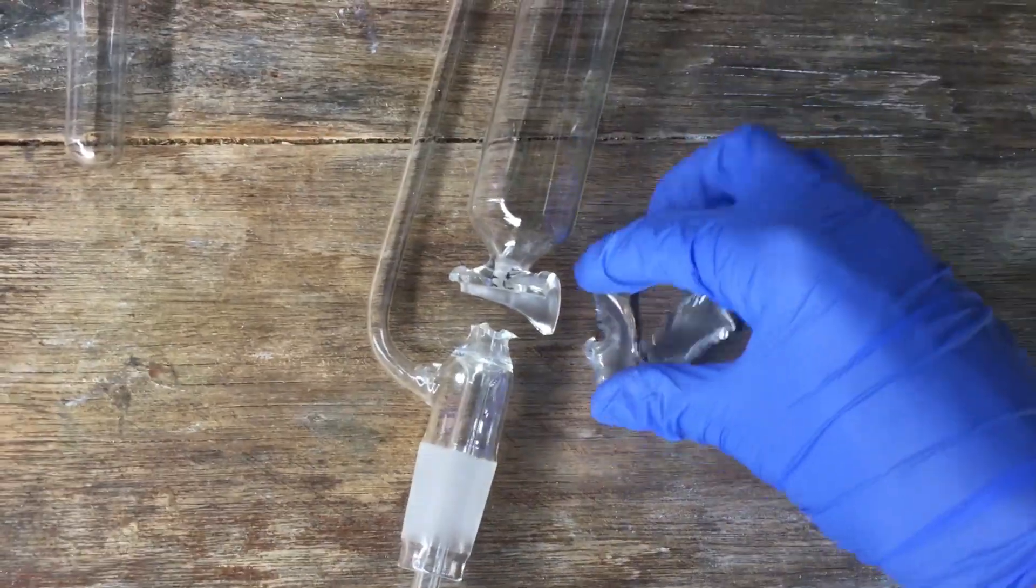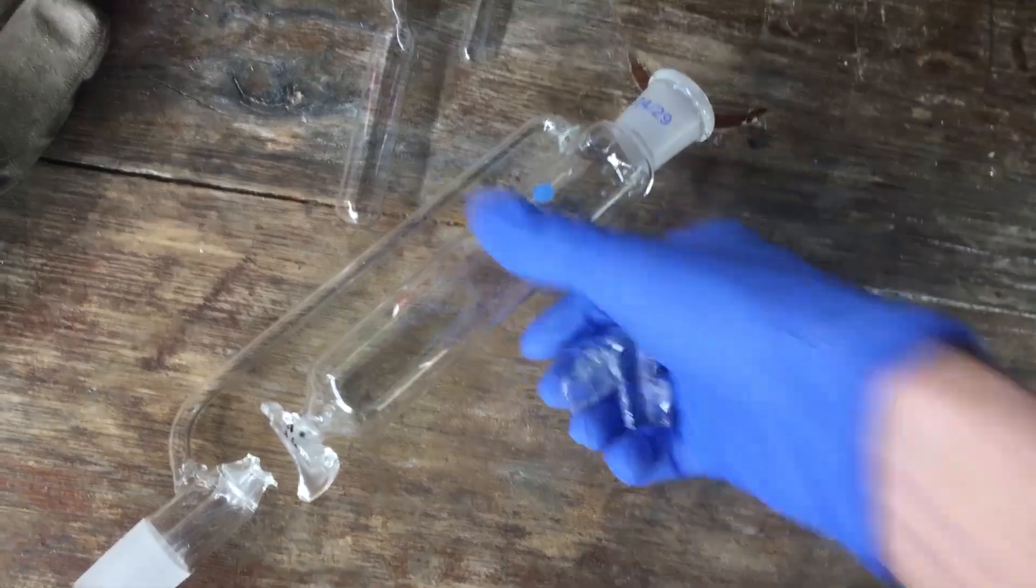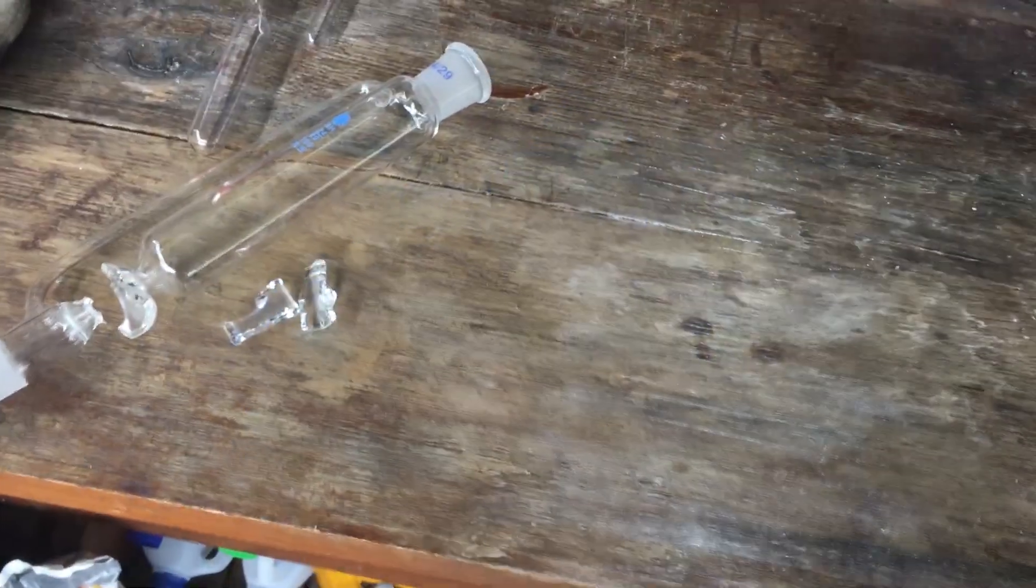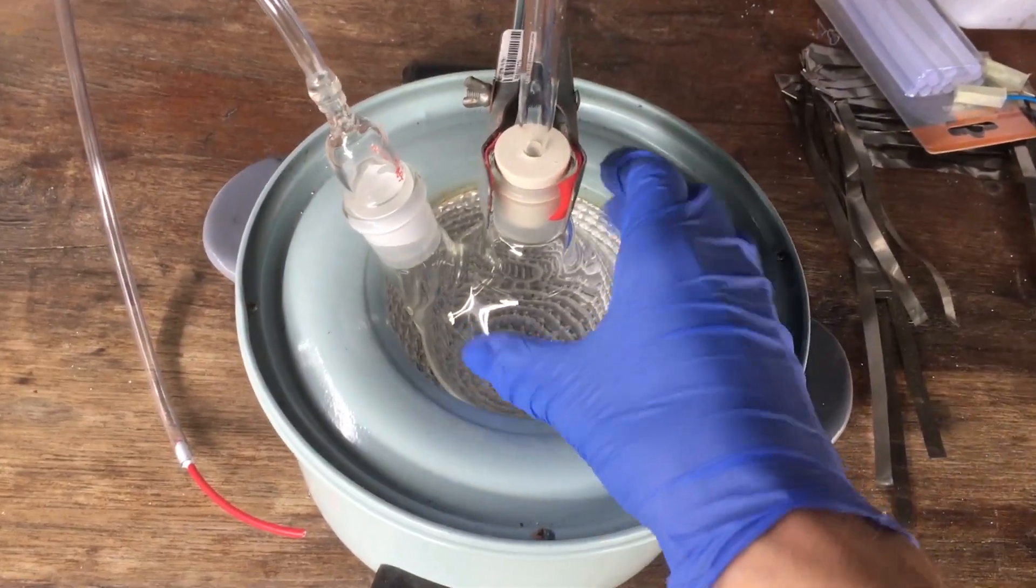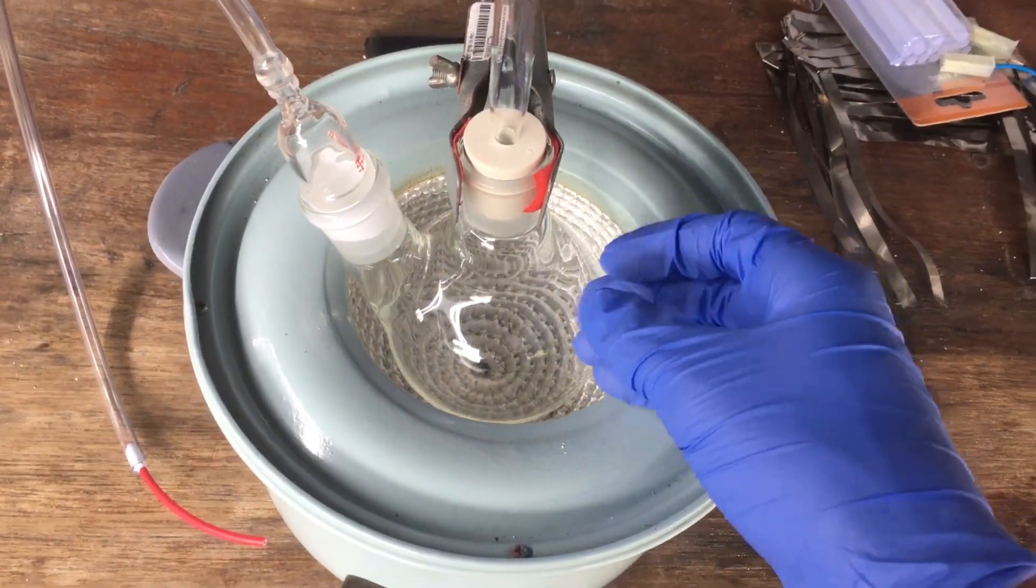I don't even know how that happens. I wasn't even using it or anything. So I've ordered a new one, but it's not going to be here for quite some time, so we have to improvise something else to use as an addition funnel. And really, seeing as we're working on such a small scale, I've put together this apparatus here. This is the two-neck flask where we will put our TCCA.